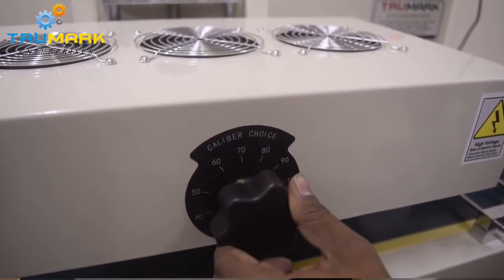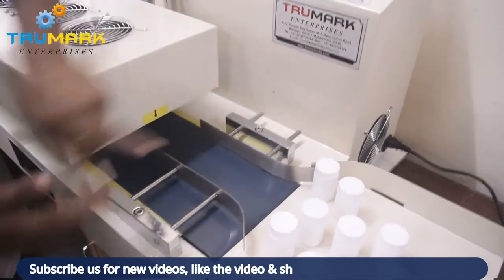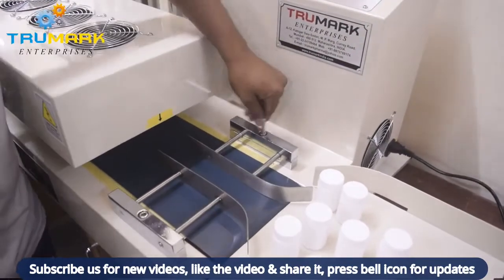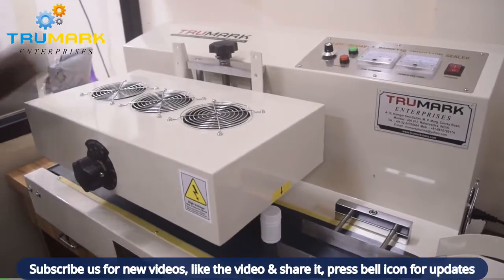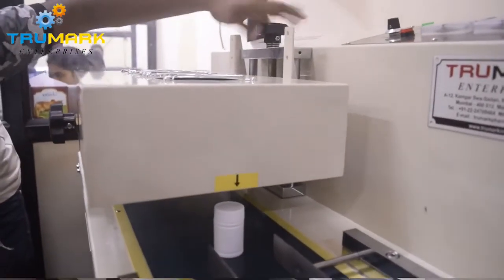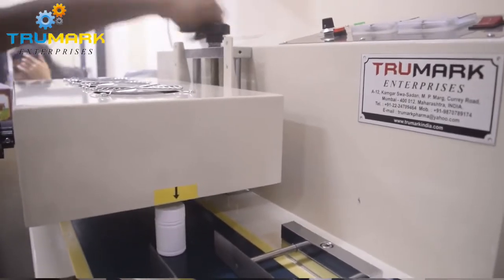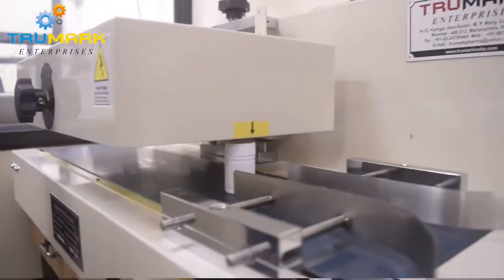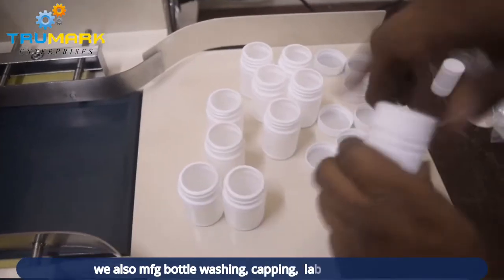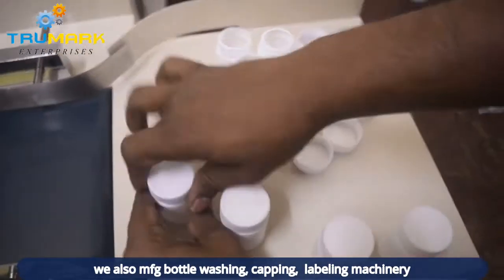Calibrate the sealing coil using the knob given so that the product gets maximum exposure to induction waves. Set the guides as per the jar size. Adjust the height of the induction head using the height adjustment knob so that there is minimum gap between the bottle top edge and the induction head.